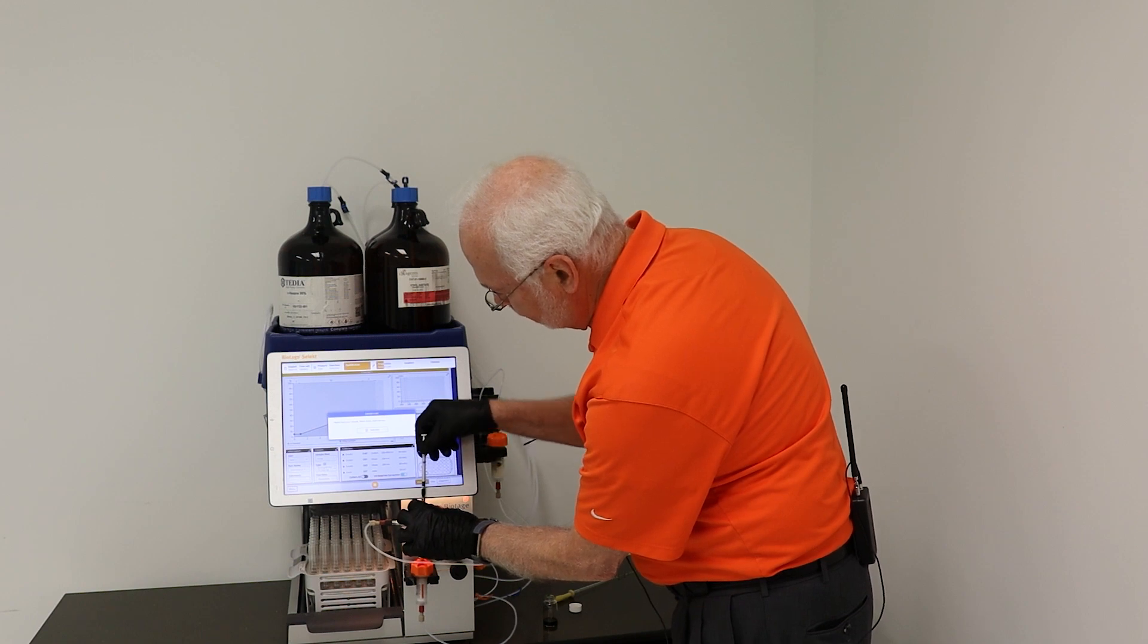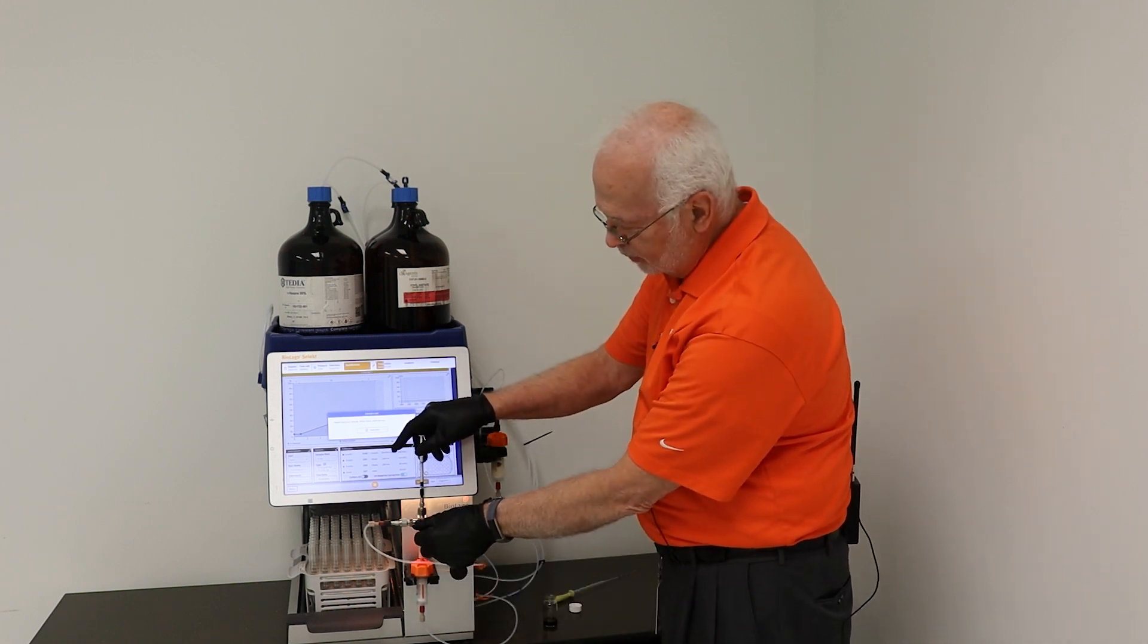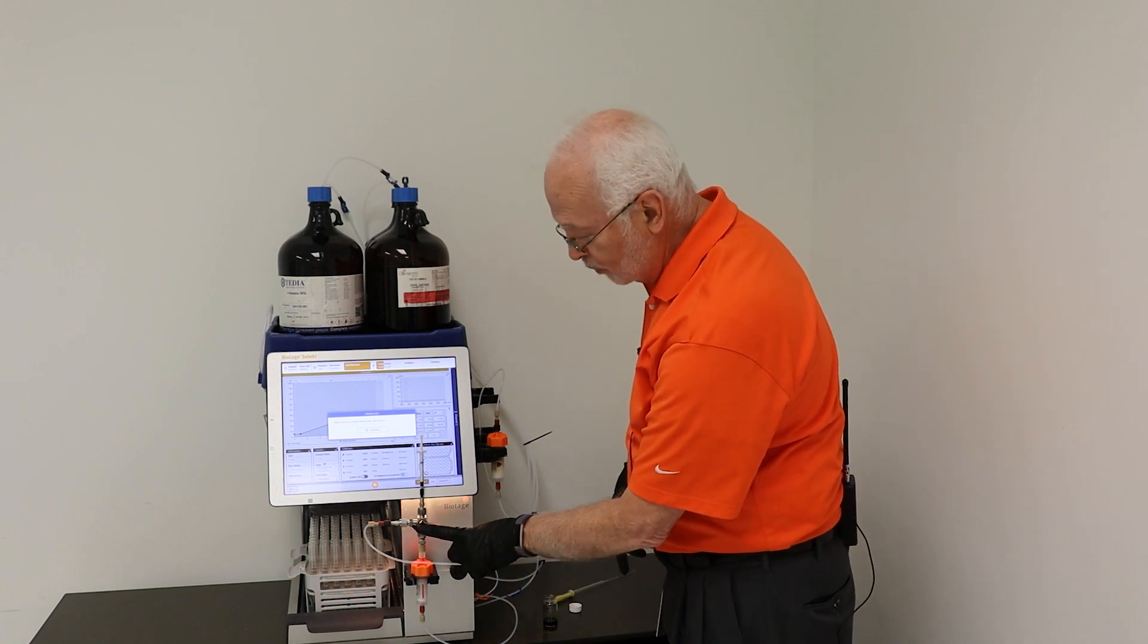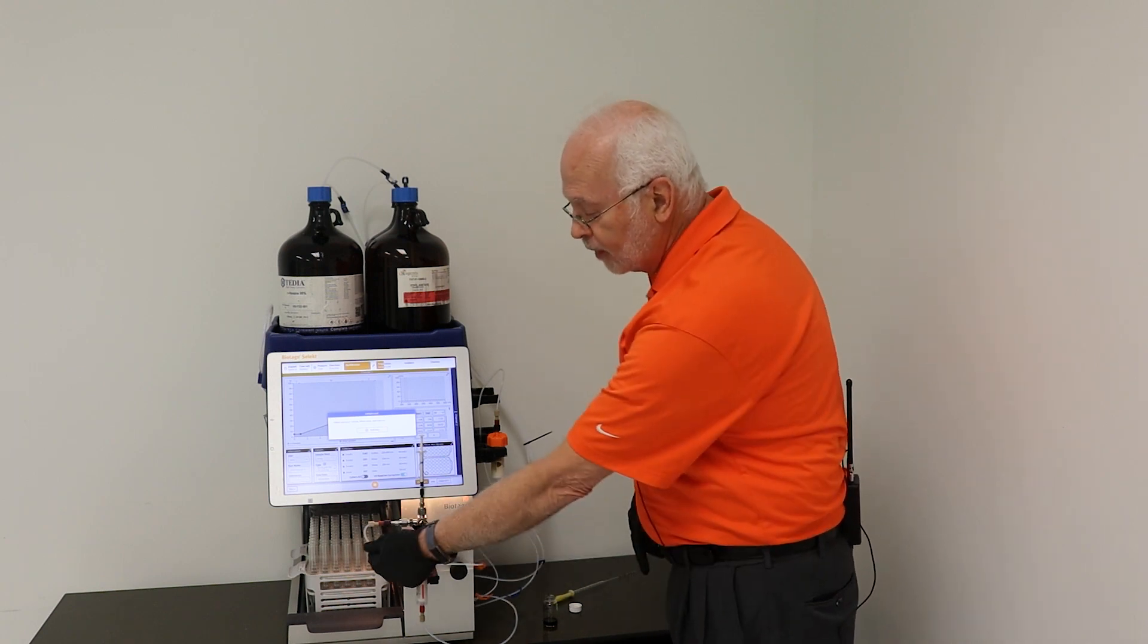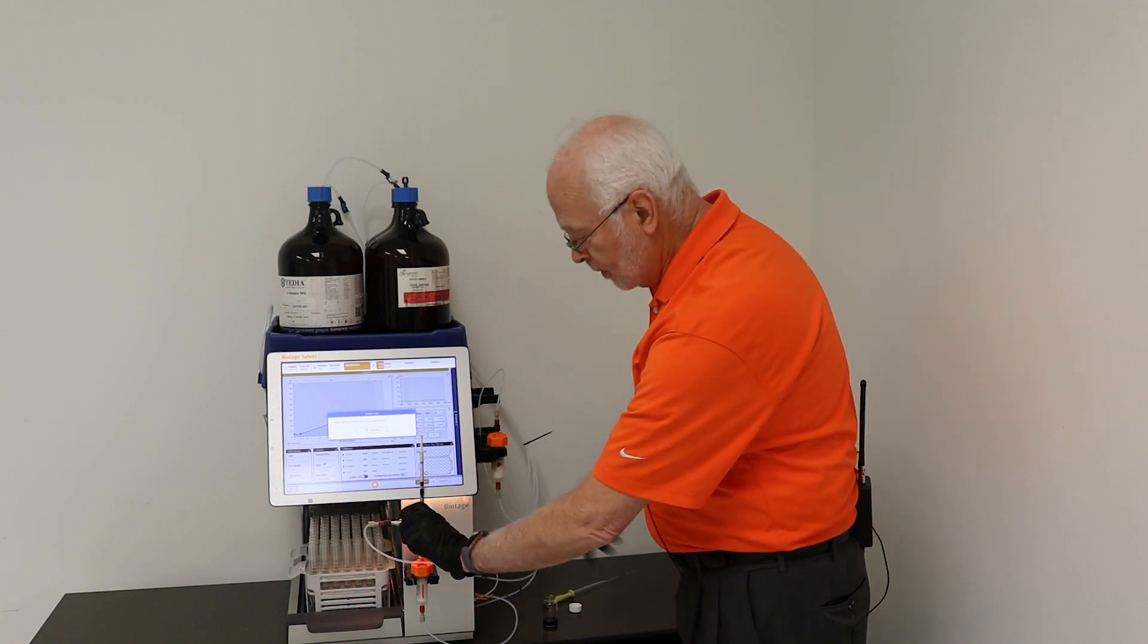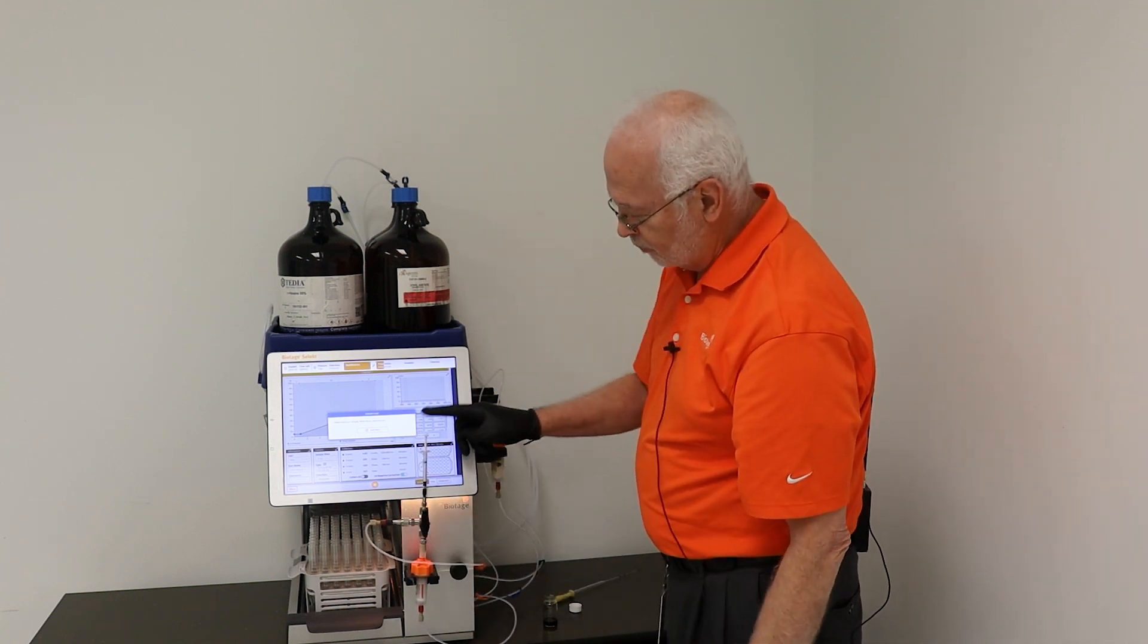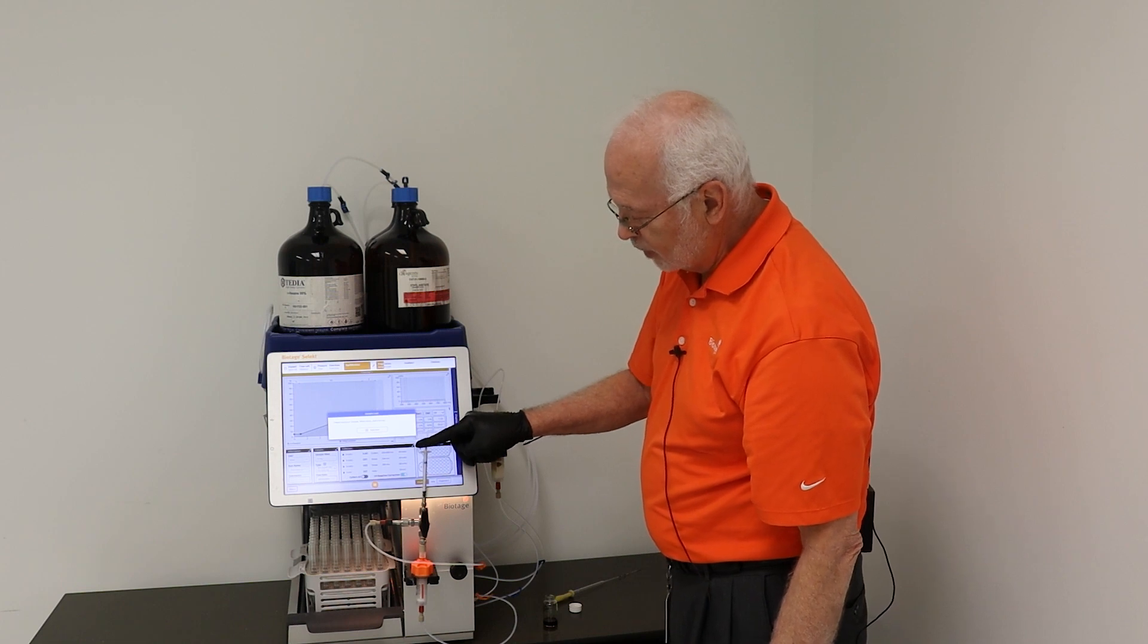This is a valve with the ability to change flow directions. Right now with the arrow pointing horizontal it's going to accept solvent from the pump. In the down position it allows you to inject the sample.